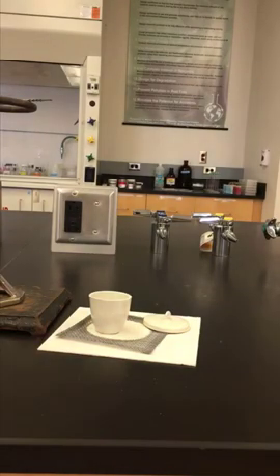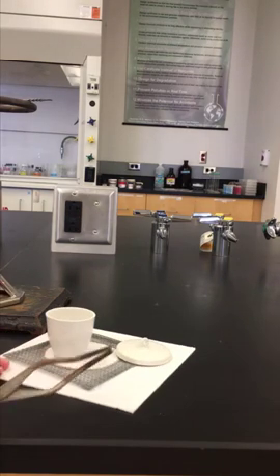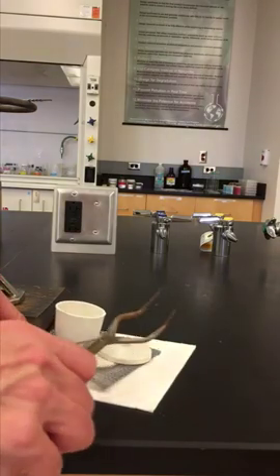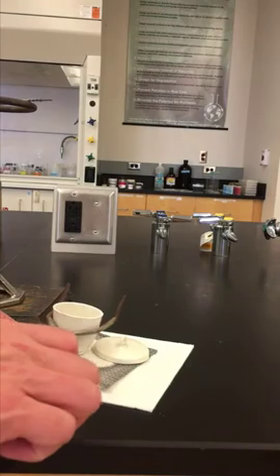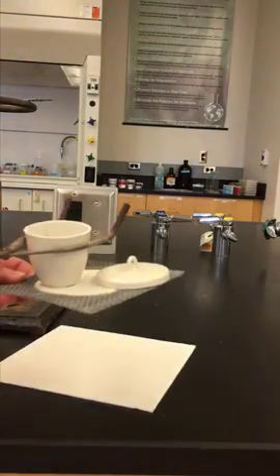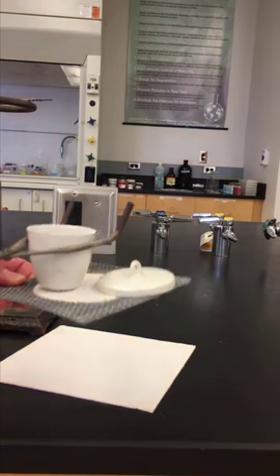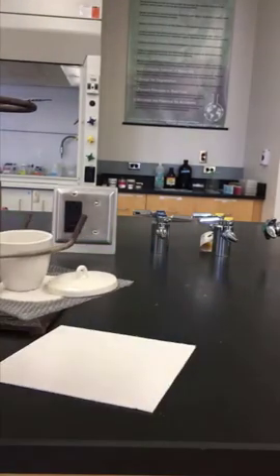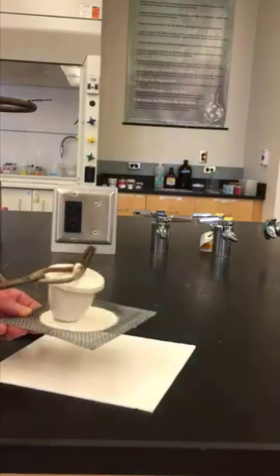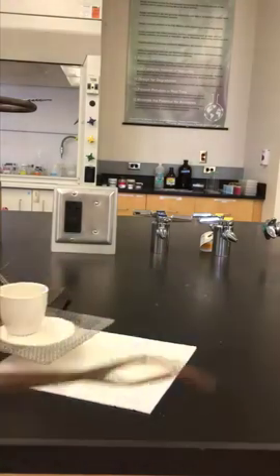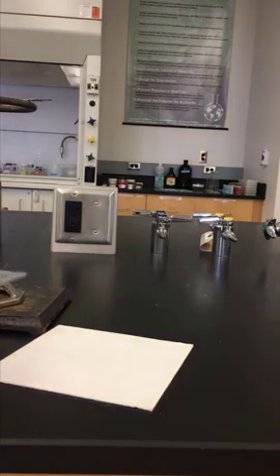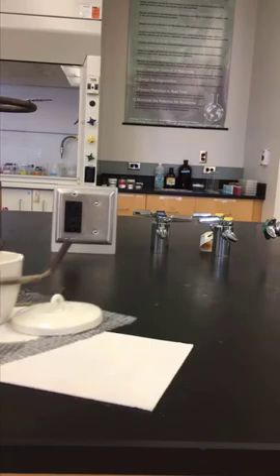Once the crucible is cool, we need to get the mass of the empty crucible. And in order to make sure we get the mass of the empty crucible, we need to be able to carry it. And to carry it safely, I'm going to carry the crucible. I'm going to keep the lid off onto the wire mesh. And I'm always going to have, at all times, the crucible tongs hanging onto my crucible. And have the wire mesh underneath. So that when we carry this, when we move it around, it is stabilized. You don't want to put the lid on and try to carry it this way. For when it's top heavy, it will fall. And then you'll have to start the experiment over. So when you carry this to the balance room, the weigh room, you want to hold onto your crucible, have the lid off to the side and carry it on the wire mesh.